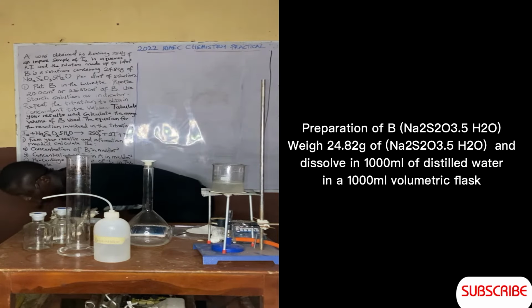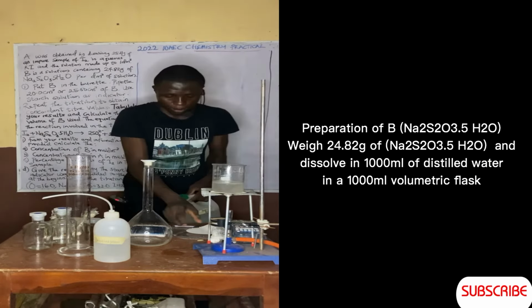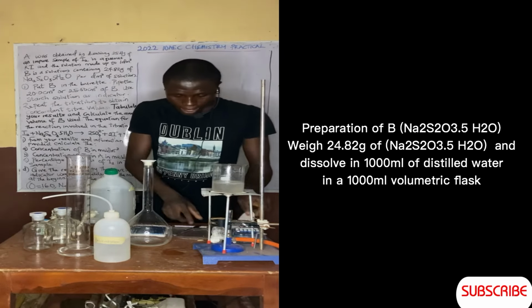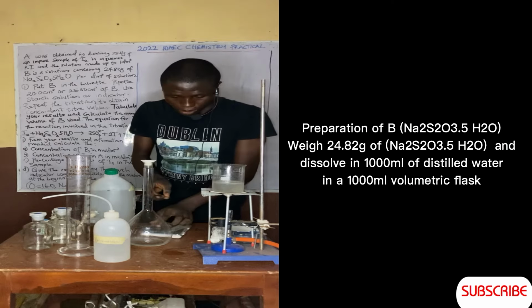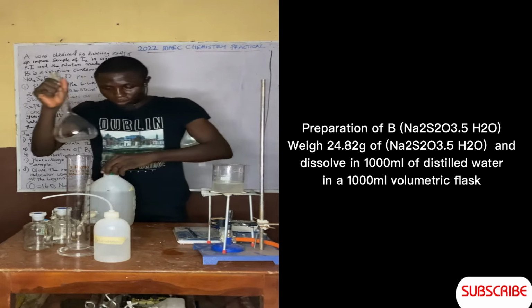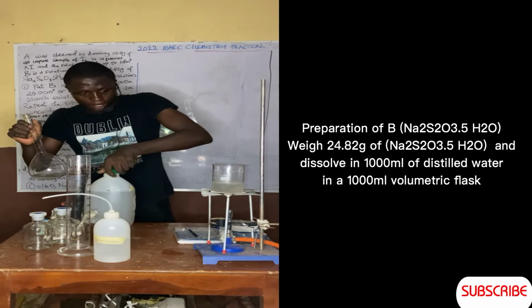Let's dissolve this by adding 1000 cm cube of water to the mark point of the volumetric flask. And then we dissolve, we shake.